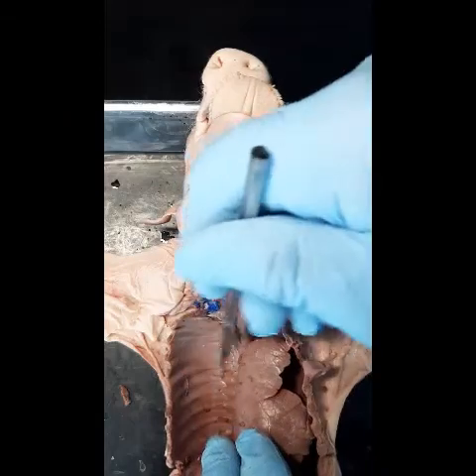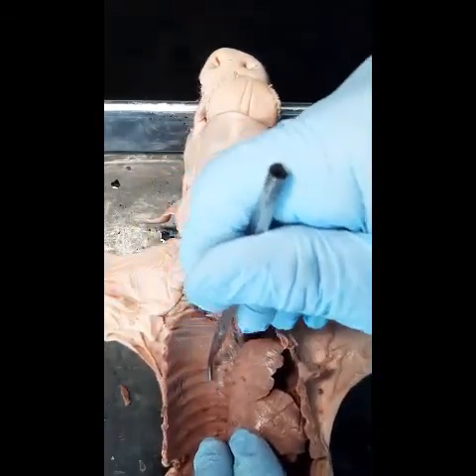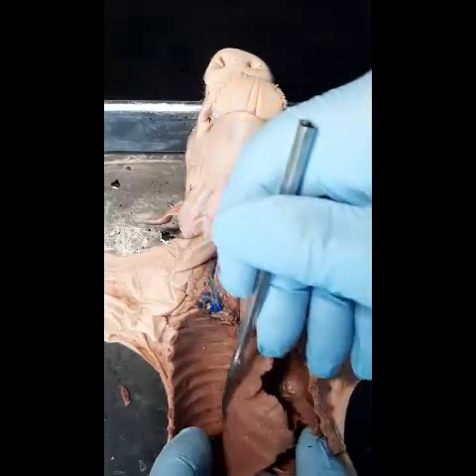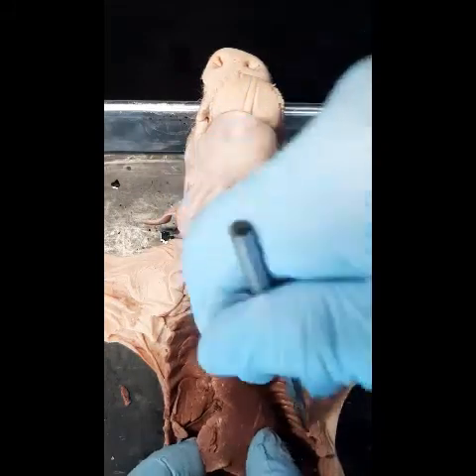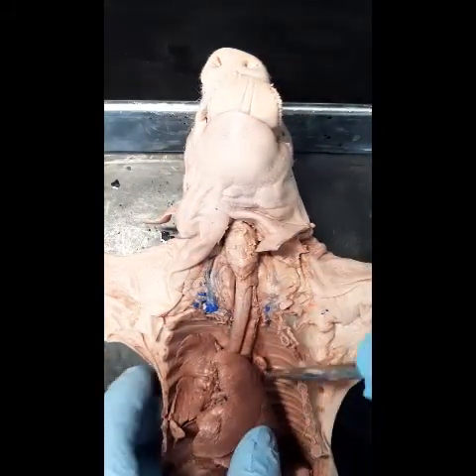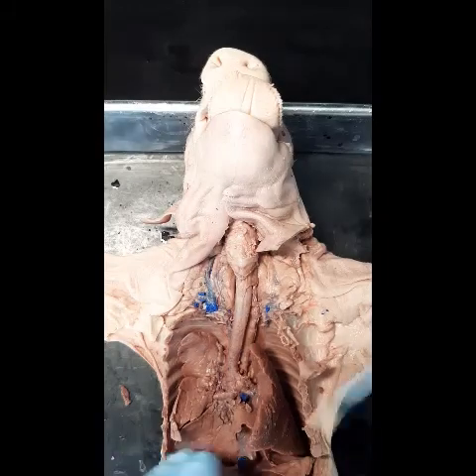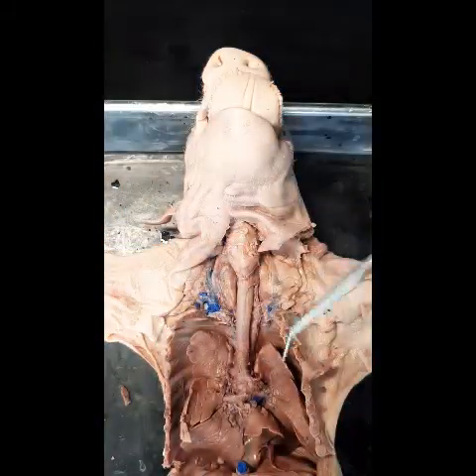This is the thoracic cavity, and the membrane attached to the wall of the cavity is the parietal pleura. The membrane attached to the lung is the visceral pleura. In between you have the space called the pleural cavity. This cavity is necessary to allow the lungs to expand and contract during breathing in and breathing out.